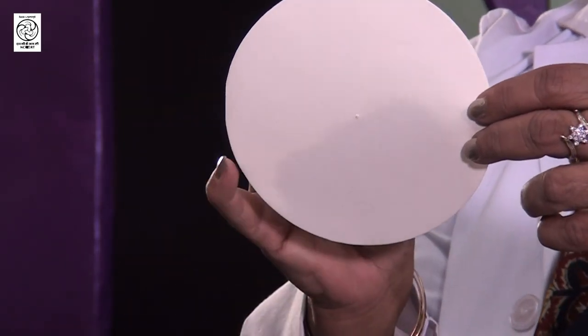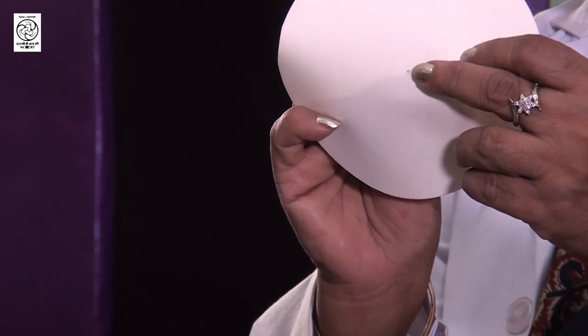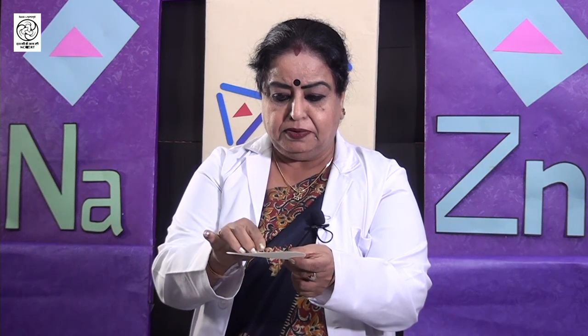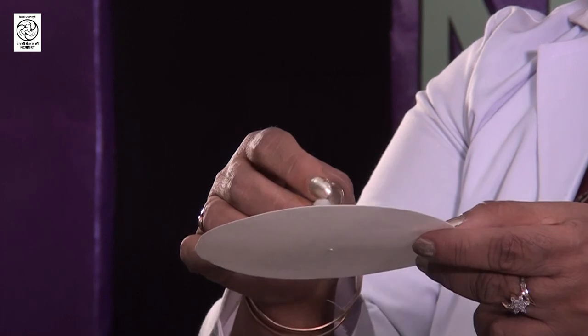How would we perform this experiment? Let us do that. Let us start doing this experiment on paper chromatography. As I have already told you, we will take this circular Whatman filter paper, and with the help of this pin, I am going to make a pin hole at the center. I have made a pin hole at the center, and this is a wick of cotton. I will now insert this wick into this pin hole.